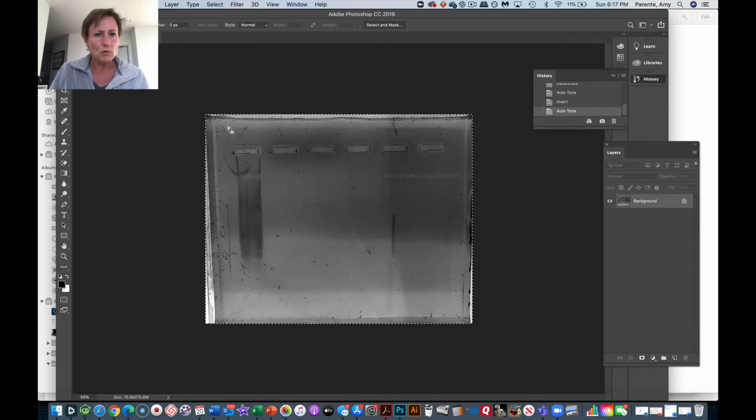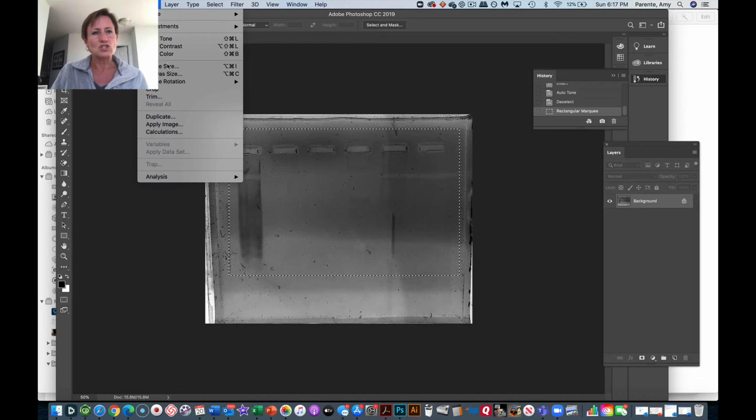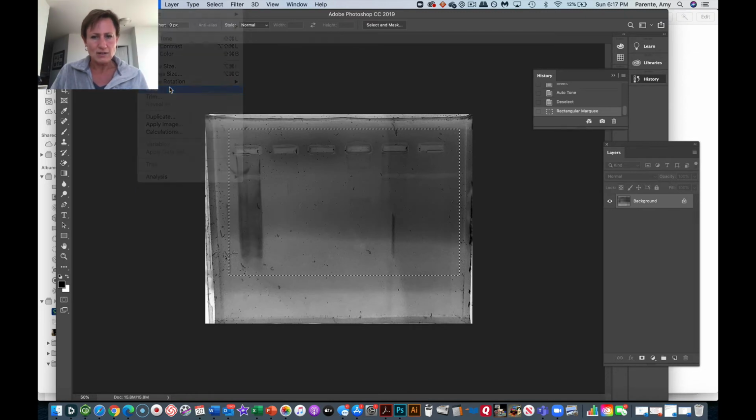So I'm going to do a little bit more. One of the things to highlight is that I made sure to do this to the entire gel. I'm going to show you in a second here. Let's crop this just a little bit more. One of the things that we don't want to do is specifically do something just to a certain band. So let's go ahead and crop this now.